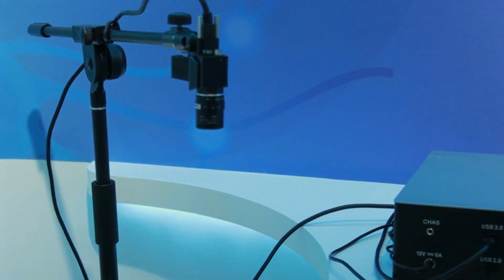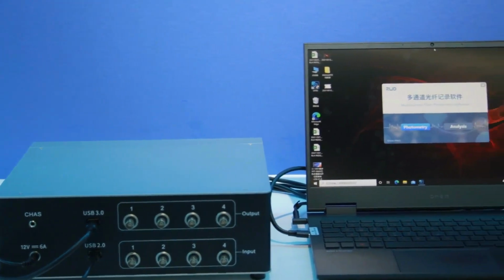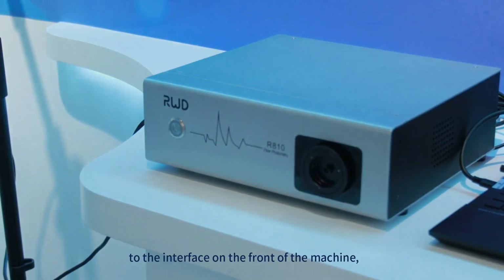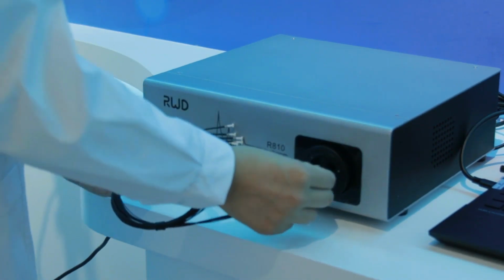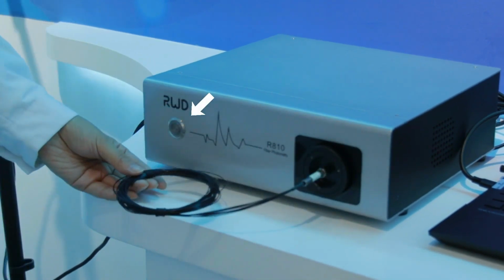The overall wiring connection is done. We connect the optic fiber to the interface on the front of the machine, then turn on the power switch. Now we're ready to experiment.